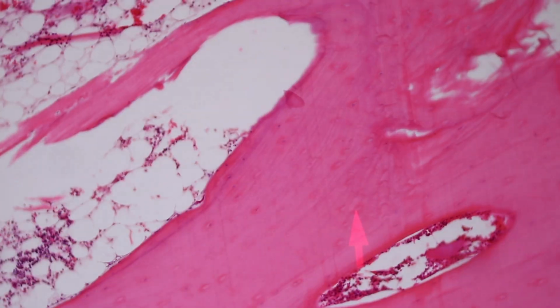So, going back to the 4 different types of lamellar bone, we have the concentric lamellae that form, here you can see, around the Haversian canal, the lamellae filling the spaces in between the Haversian systems. One ends here, another ends here, is known as the interstitial lamellae. The interstitial lamellae represent remnants of a previous Haversian system that's been partially destroyed by osteoclasts.